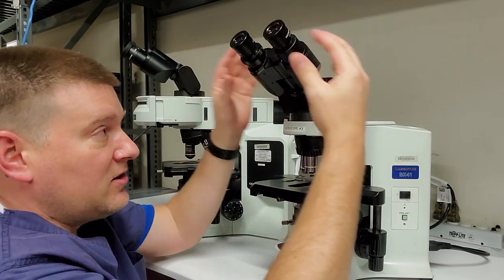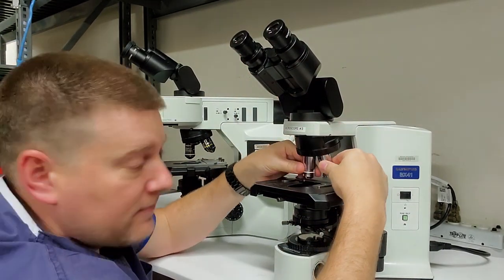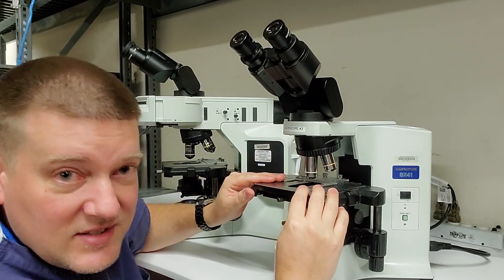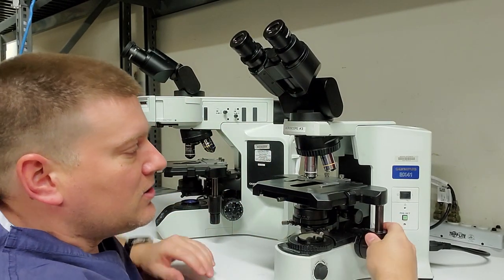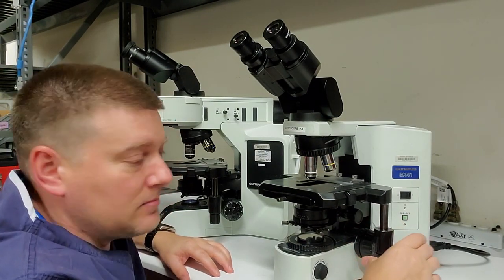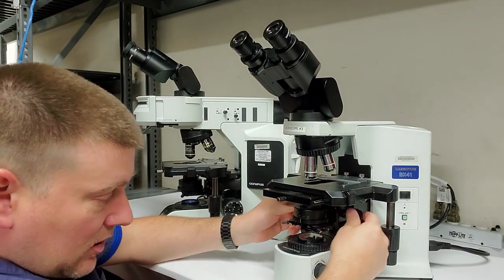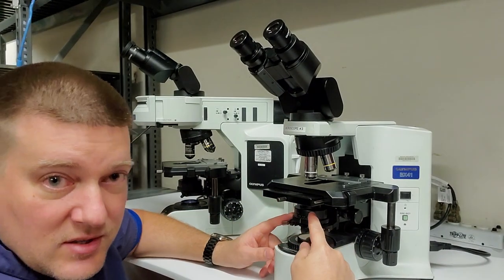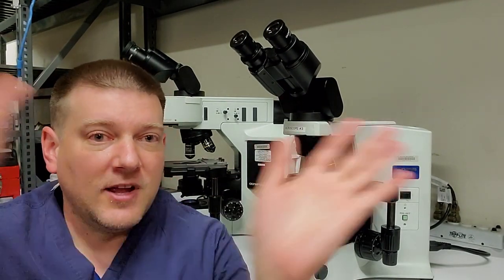So we have your oculars, your binoculars, your headstock, we have your turret, you have your objectives. Next is your stage, just like a performing stage. Ta-da! It's a stage. Your stage on these microscopes moves all around. It's got an X and Y axis, okay? And right beneath your stage is going to be something called a condenser. Now, your condenser is basically just that. Light patterns tend to want to go off to the sides. You know, they always want to flail outwards.